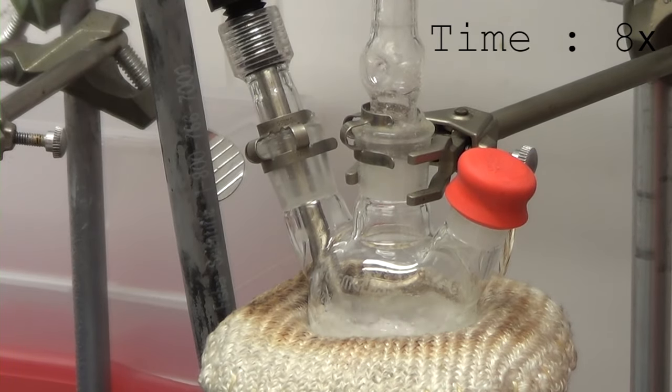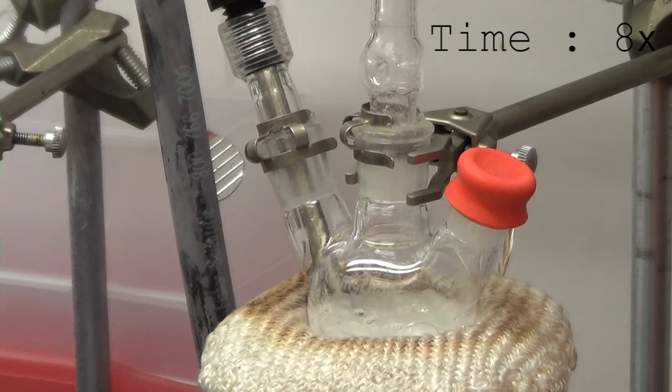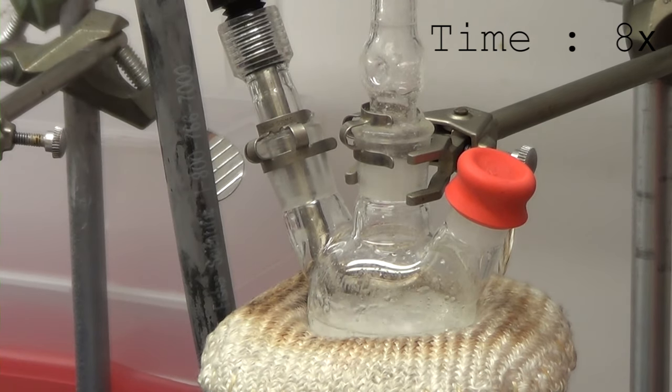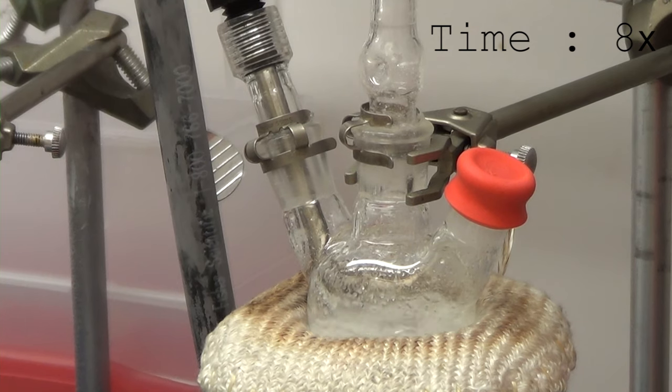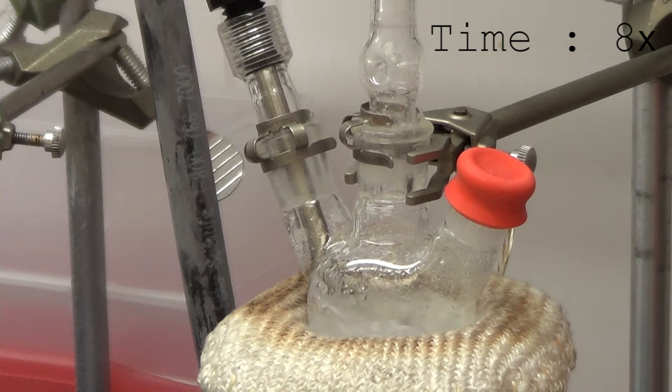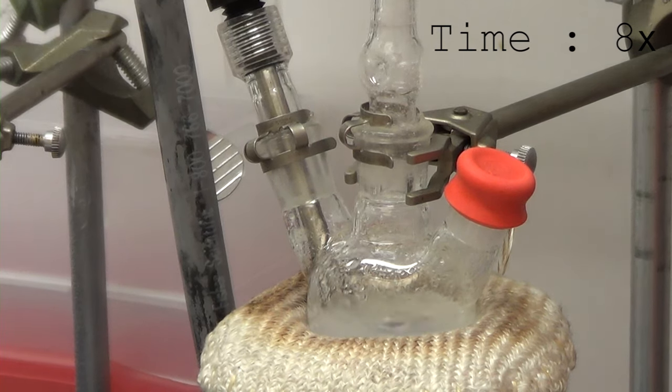The reason that's important is that that does not damage the septum so that we can pull vacuum on it. So we're heating this up to 100 degrees and pulling vacuum, and that is going to effectively degas the solvent of any air, water, residual acetic acid and whatnot from the cadmium acetate. But we've sped up time here as you can tell. We also have a pressure gauge on the Schlenk line to know when the system has fully degassed, which is kind of hard to tell otherwise.